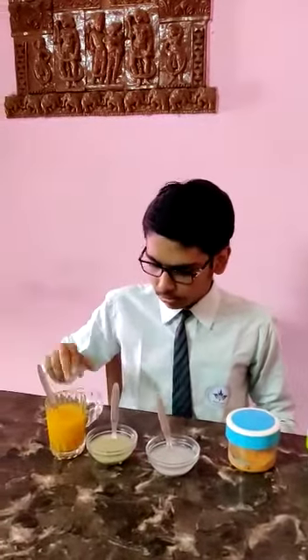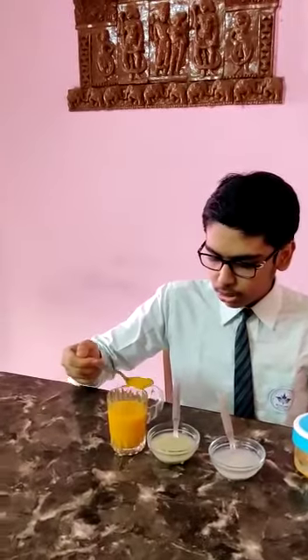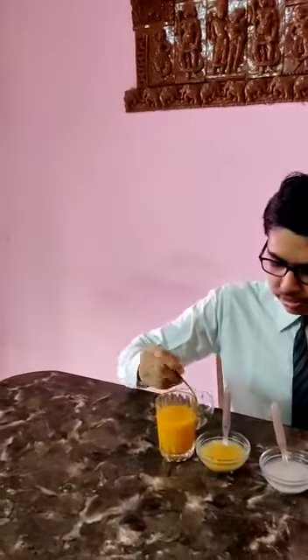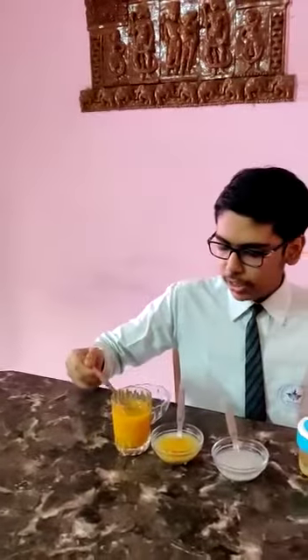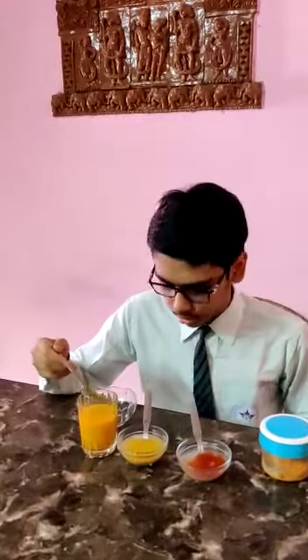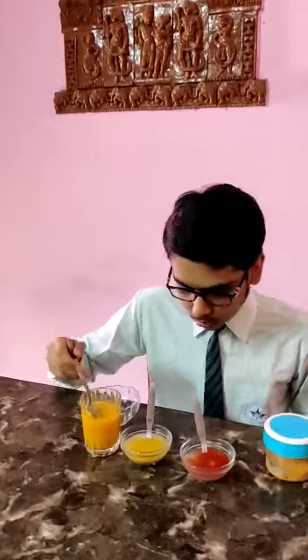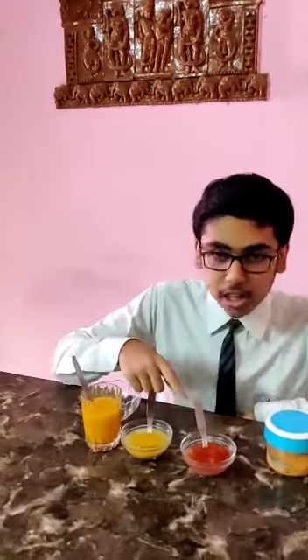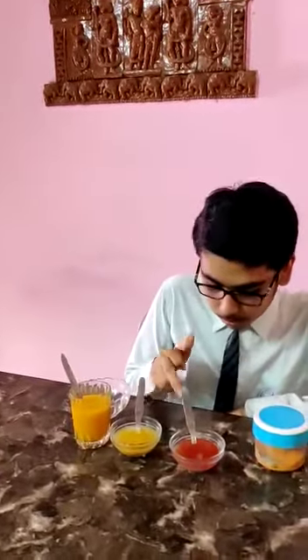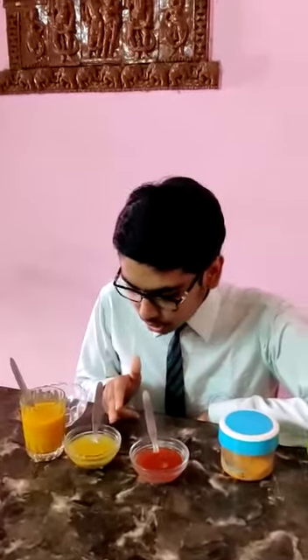At first I will add some turmeric solution in the acid and then I will add some in the basic solution. We can see that the color of the basic solution turns red, and there is no color change in the acidic medium.